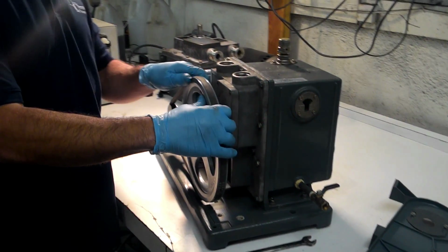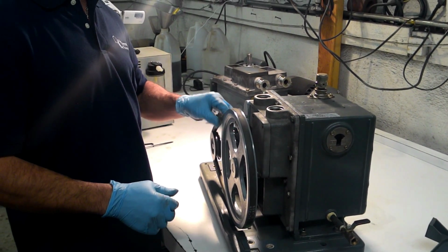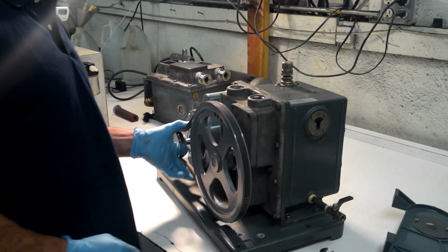Hey guys, my name is Lee again here with Chemtech Scientific, and what we're going to show you here today is how you do a belt alignment, and also the tension, on how much play you should have on the belt.